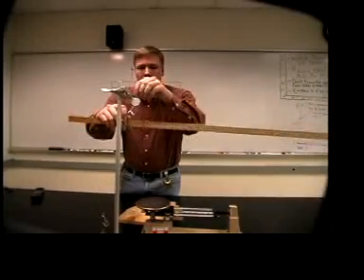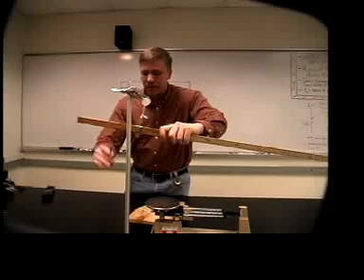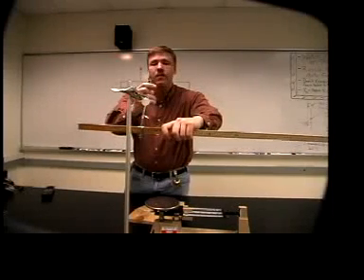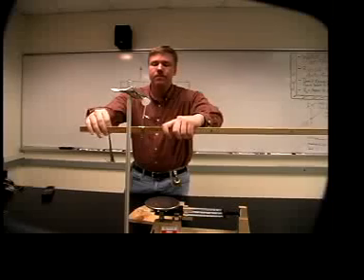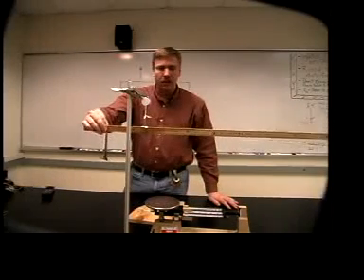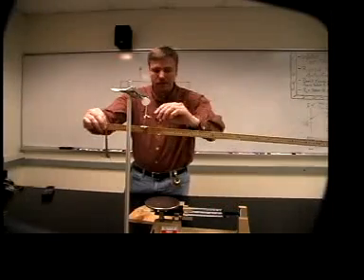So you're just going to hang this. Don't forget that these mass hangers are 50 grams each. So when you hang the hanger from the stick and add masses, you're supposed to add masses until you get it to balance. When you get it to balance, do your calculations.